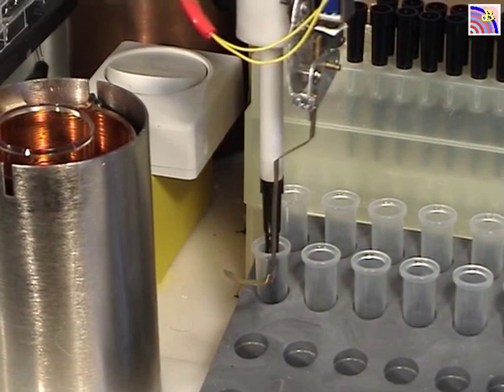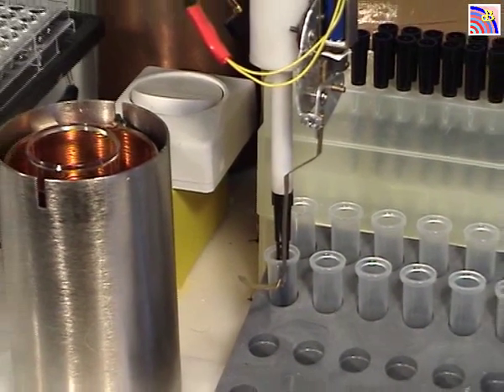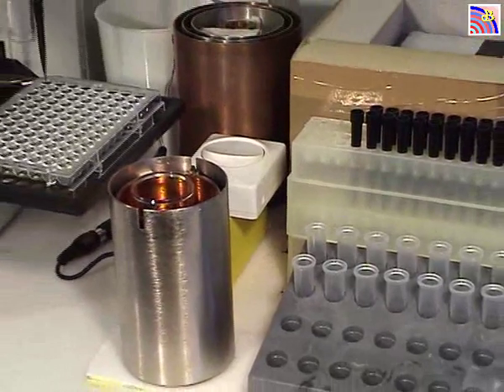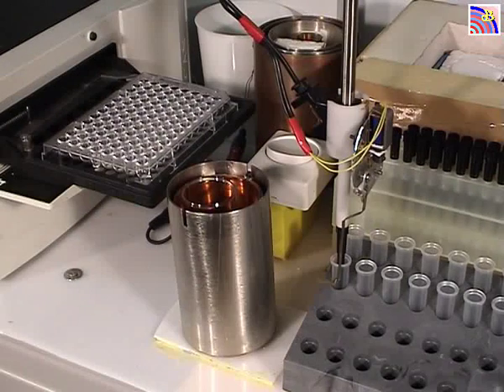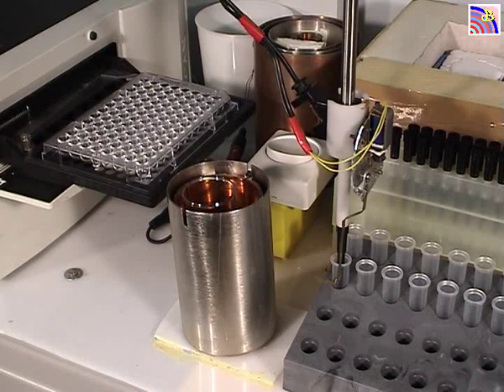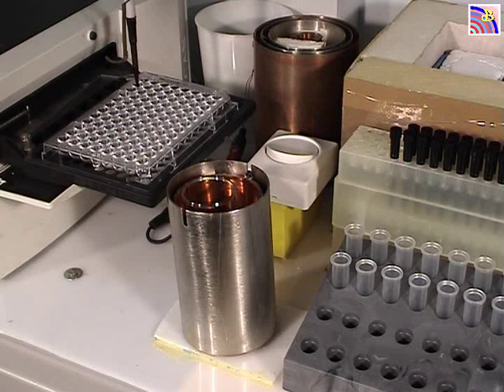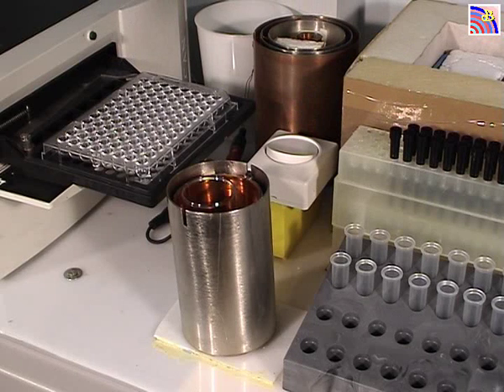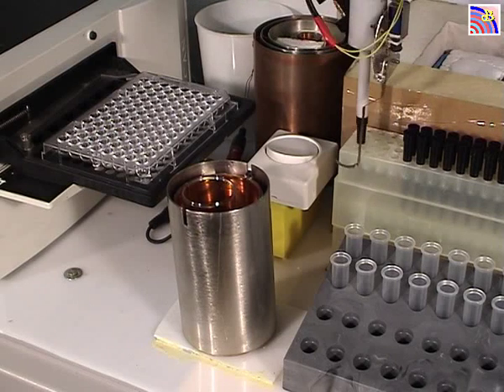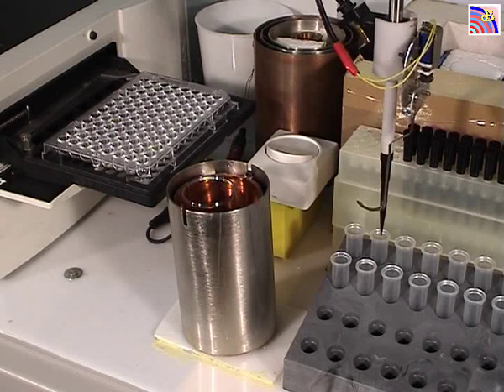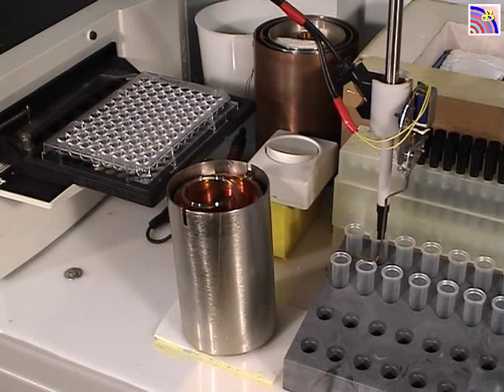All right, and we will now dispense the content of this mixed first tube into two wells of the 96-well plate which is waiting on the plate of the spectrophotometer.